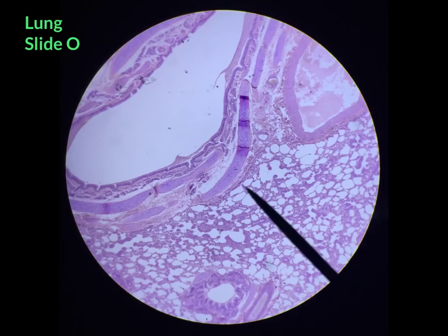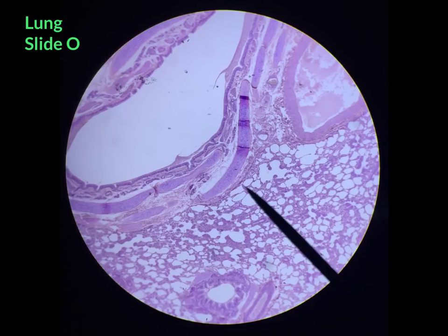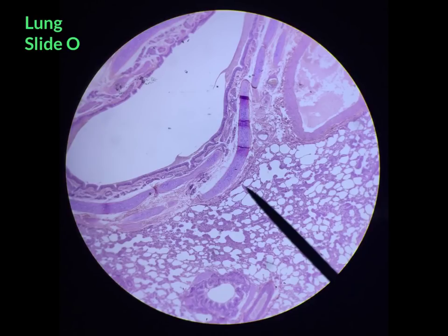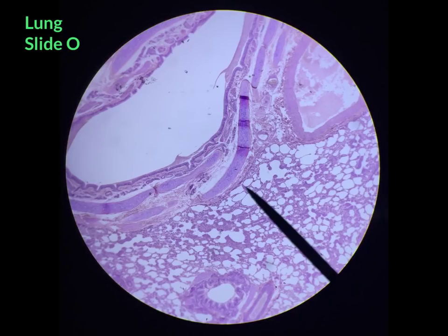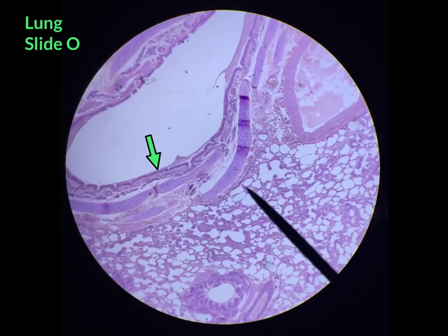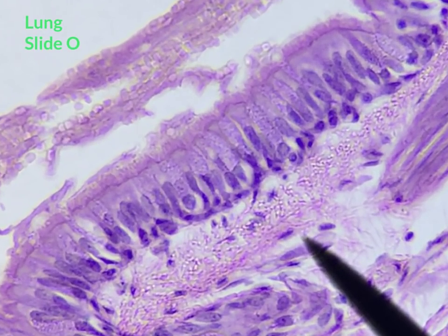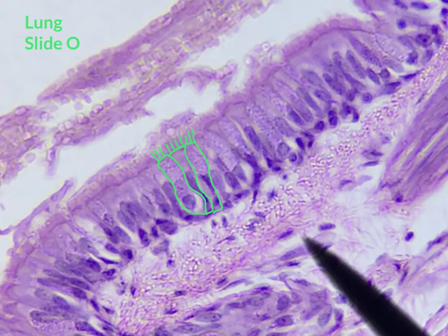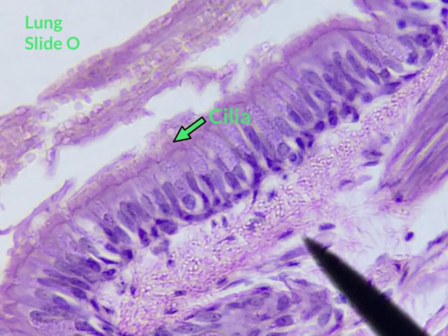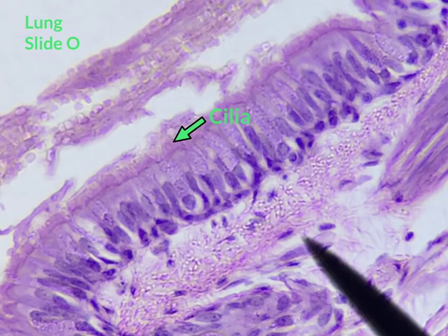Next, we are going to go back to the lung section from slide O to look at pseudostratified ciliated columnar epithelial tissue. This type of tissue lines the air passageways, so look for a big white open space, or lumen — lining it should be pseudostratified ciliated columnar epithelial tissue. Under high power at the lining of the lumen, we can see the pseudostratified ciliated epithelial cells. At the ends of these cells, you can see the cilia — hair-like projections extending from the apical surface — which help transport and move substances across the apical surface.